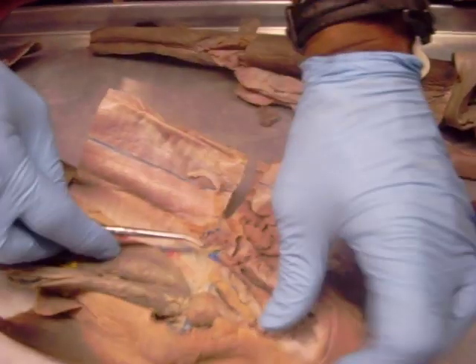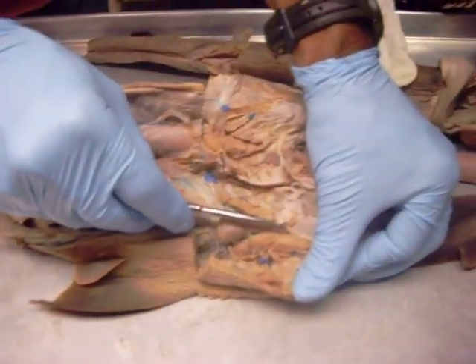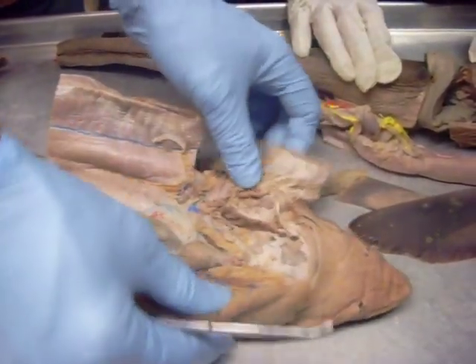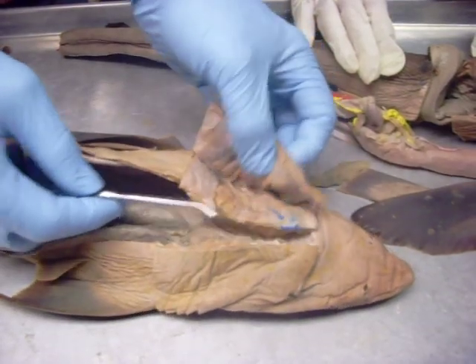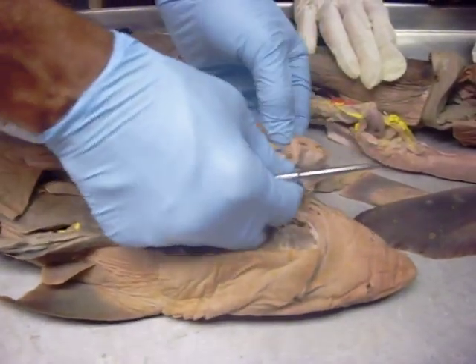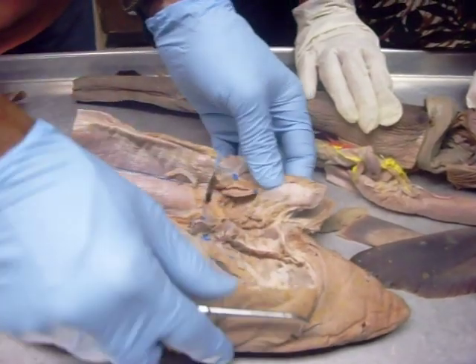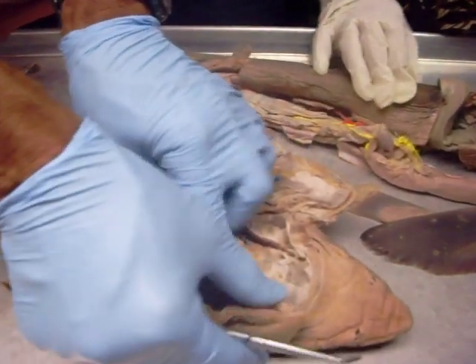It goes into here — this is the ventral aorta. Then coming off of the ventral aorta, you should be able to see the afferent arterioles. They would be in here; I don't see them very well, so I'm not going to point them out.